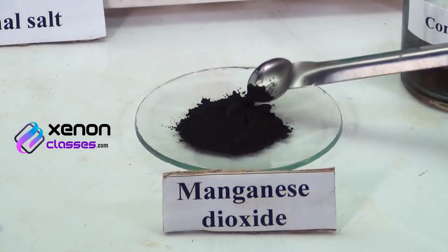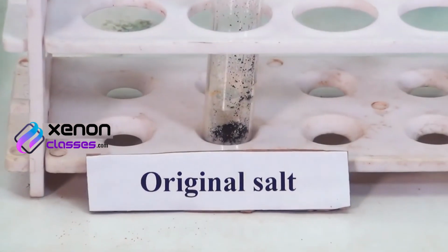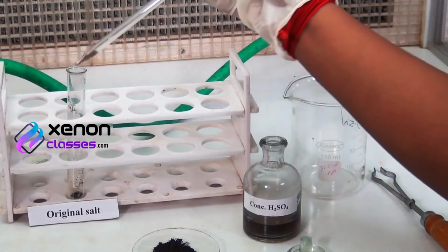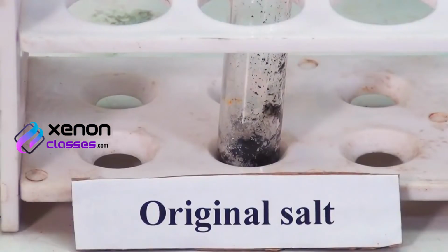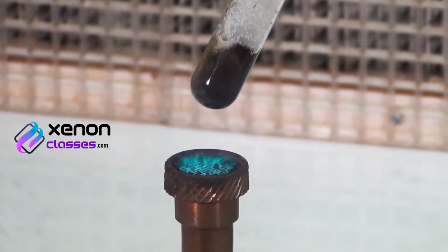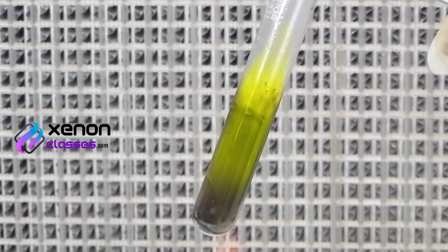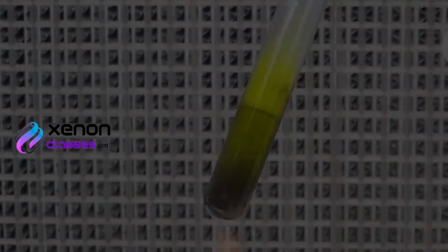To this, add a small amount of manganese dioxide powder using a spatula. Now add a few drops of concentrated sulfuric acid using the dropper. Heat the contents of the test tube over the Bunsen burner. Chloride reacts with manganese dioxide and concentrated sulfuric acid to evolve a greenish-yellow gas of chlorine.